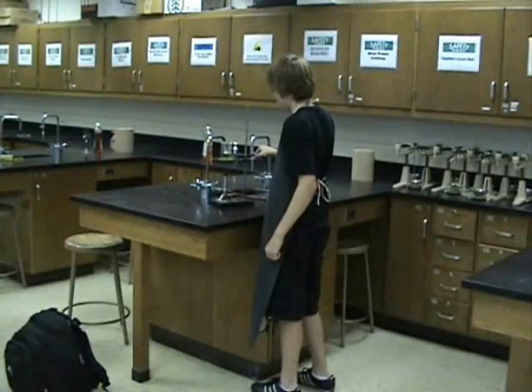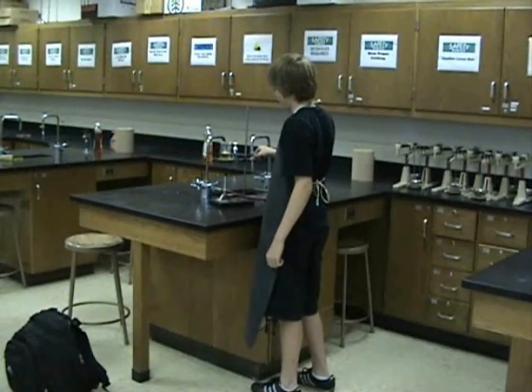Are you tired of dying in chemistry class and receiving F's? If yes, then this video is for you. Observe what happens to the student because he is not wearing safety goggles.